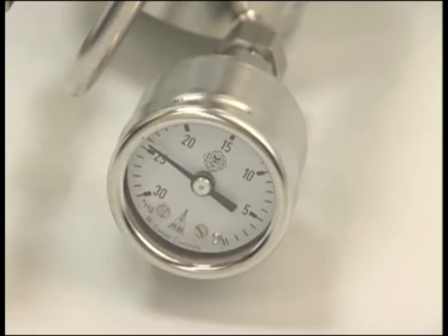The gauge should show 25 to 30 inches of vacuum and sampling has started and will continue for the entire sampling period for which the regulator was set up when you placed your order.